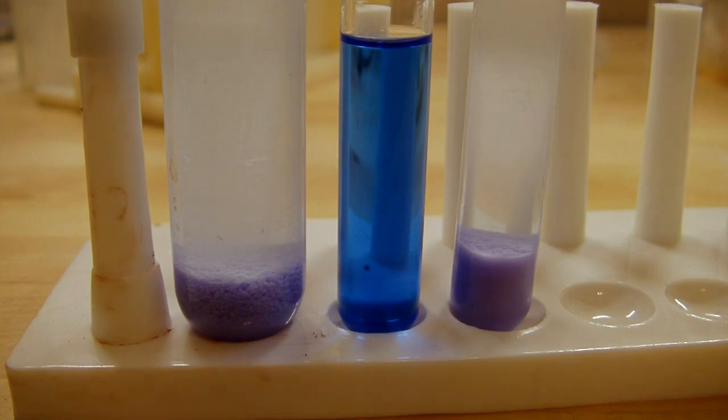You can see that it stayed that nice blue color and this is kind of a nice comparison between what the blue used to be, what the solution used to look like as to what it is now after the addition of acetone. So now the last thing I'm going to do is just take this and filter it off and collect the solid product, and I'm going to filter this outside I think just because the majority of this is acetone so it's going to smell pretty awful. When I'm filtering it I'll be washing it with a few more amounts of acetone just to rinse off any of the liquid. I don't want to wash it with water of course because then it would redissolve in the solution and that's not what I want.